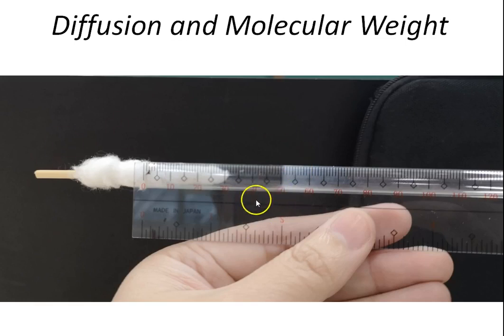Knowing that this is the distance traveled by this reagent, what is the distance traveled by the other reagent? And what is the chemical product of this white precipitate ring?